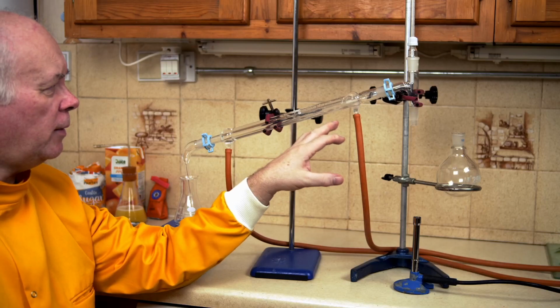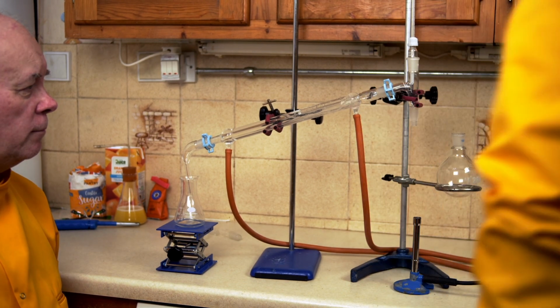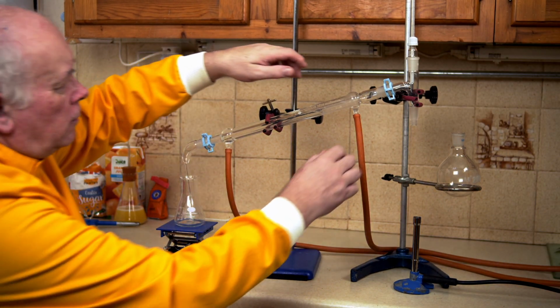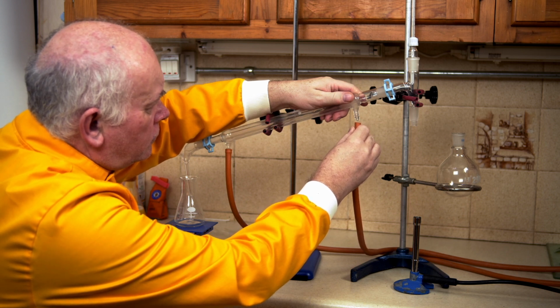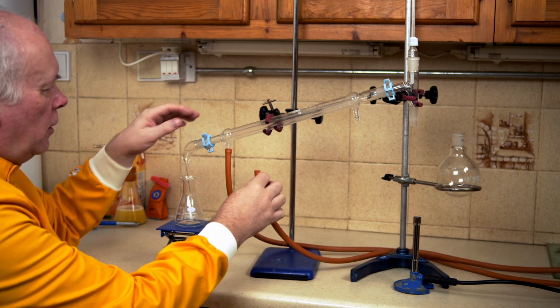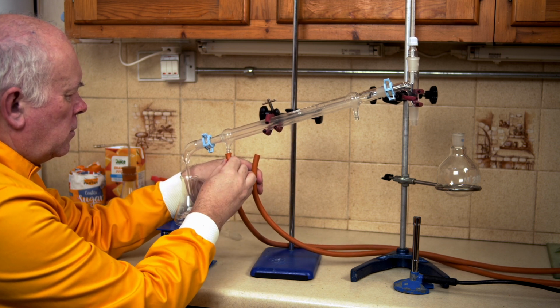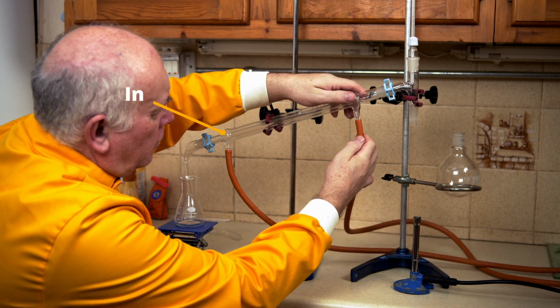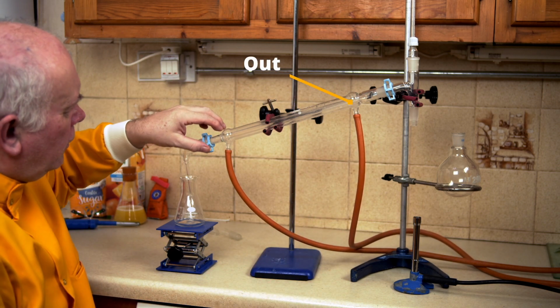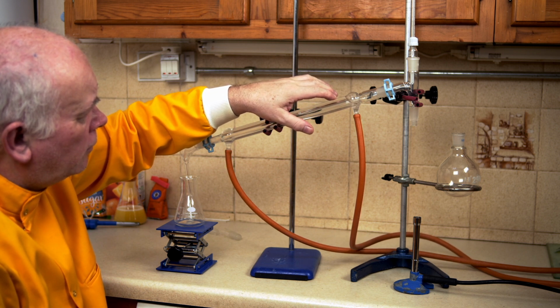So what we need is to have the water going the other way, and this may make some more sense. So let's stop the water going through, and we'll just disconnect and see what happens if we set it up the right way. Right, if I now unplug this one, this is going to let the water flow out, and now I'm going to disconnect this end and put the water in at the bottom. So the coldest water is now going to go in at the bottom, and come out at the top. So now the water goes in, it flows much more nicely. That'll do.